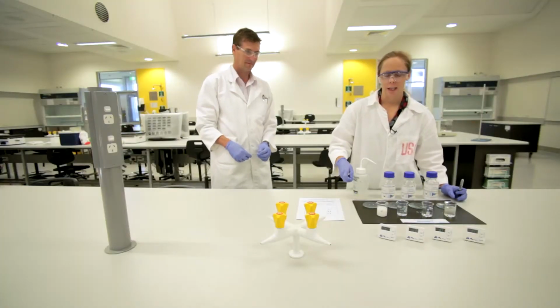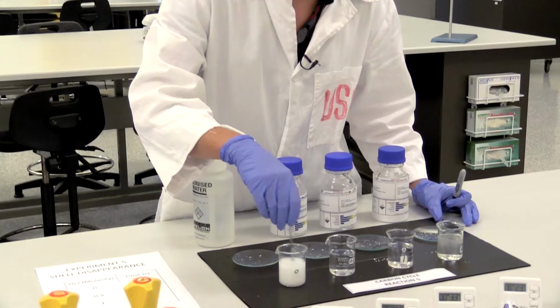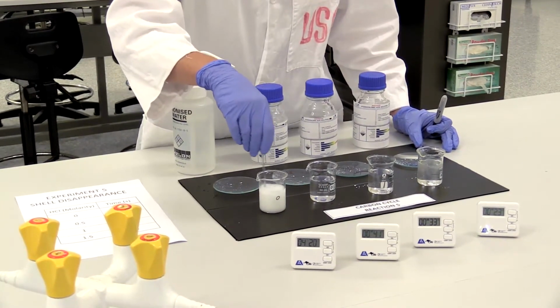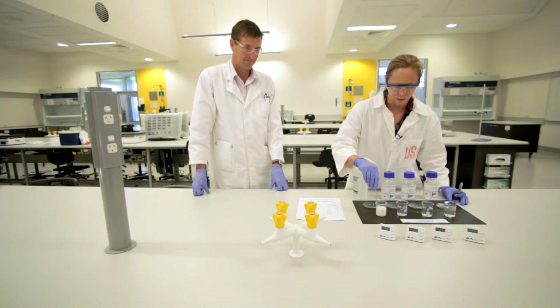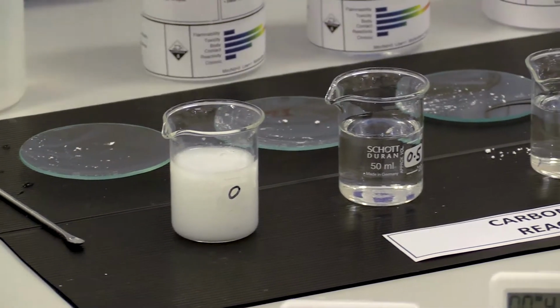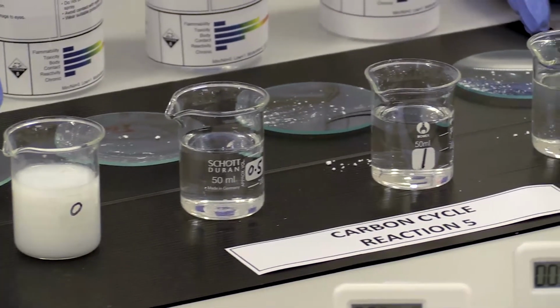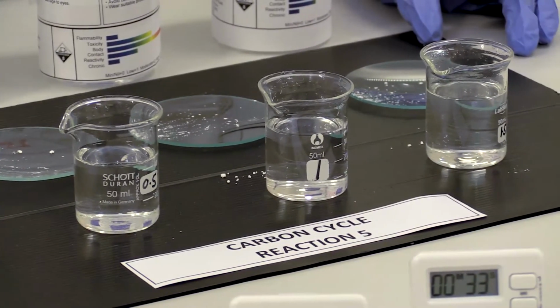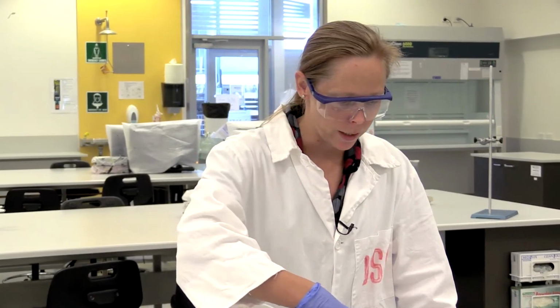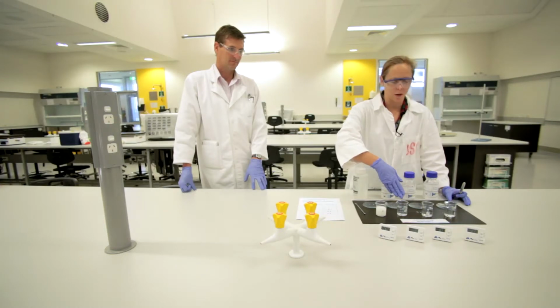You can also see that no matter how much I stir the water, it's never going to change from calcium carbonate. There's just calcium carbonate in there, as opposed to having calcium chloride, which is soluble. Calcium carbonate is insoluble. So it means our oceans, as they are, the shells can survive. Shells which are calcium carbonate will survive, but if we acidify our oceans too much, we'll have no shells left because we'll have calcium chloride which is soluble.